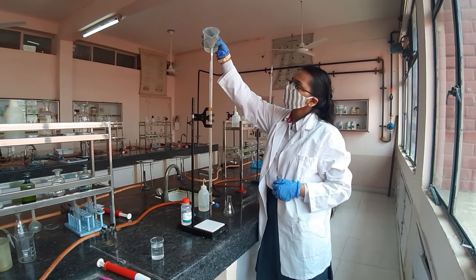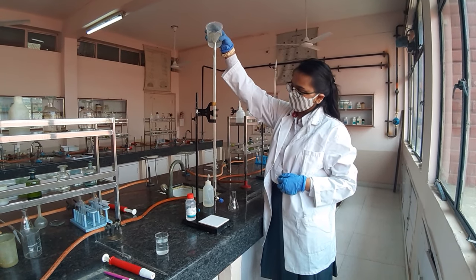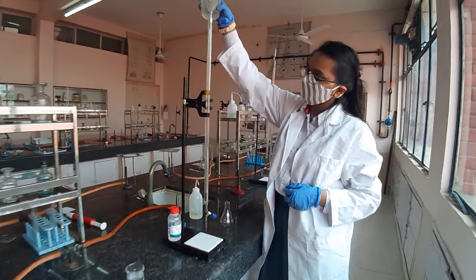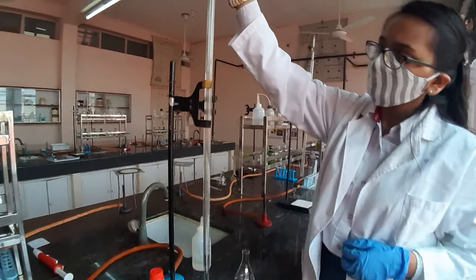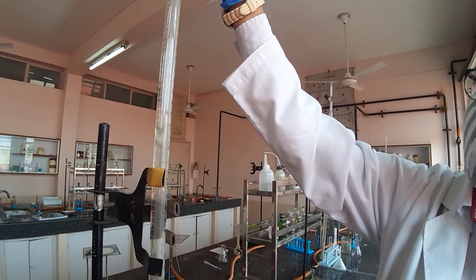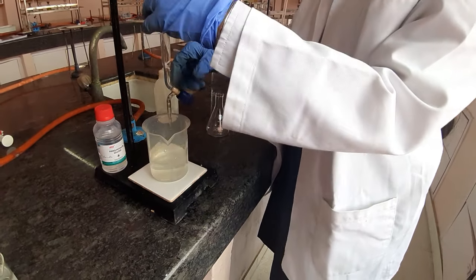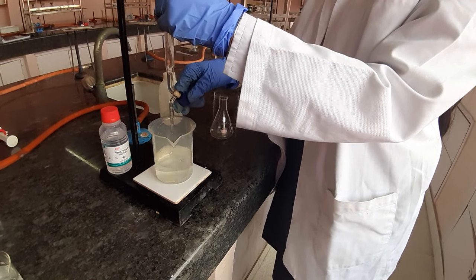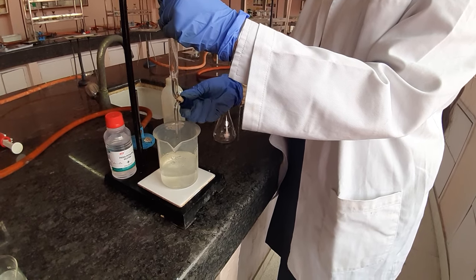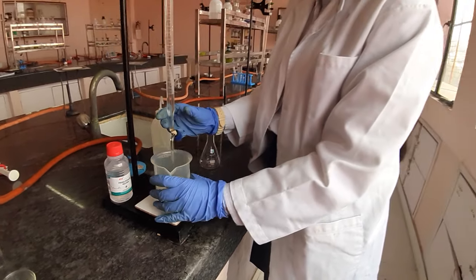Now you can fill up the burette with NaOH. You should use a funnel to transfer NaOH into the burette. Can you see the level rising? Pass some amount of NaOH through the nozzle so that the nozzle is also full of NaOH before you begin the titration. Now you are ready with the burette.